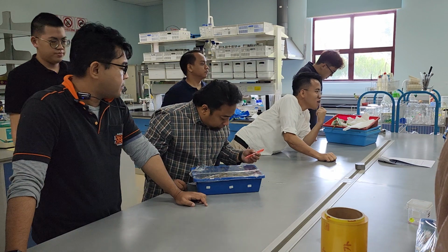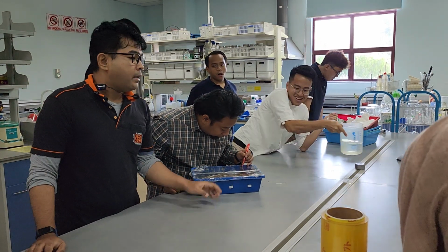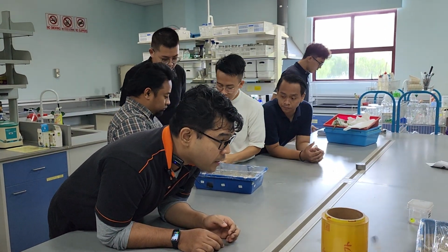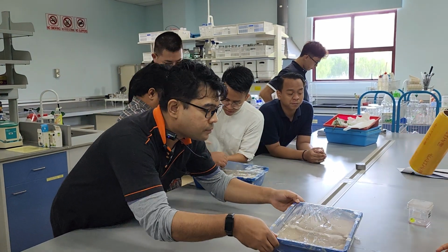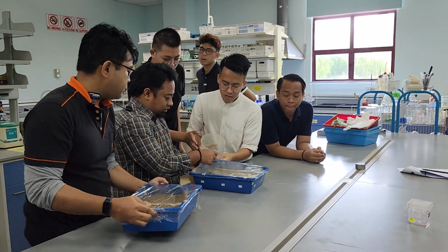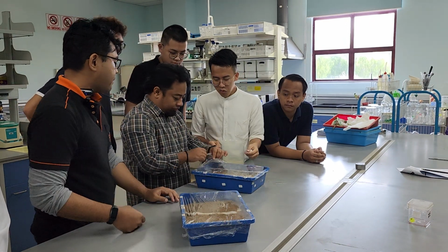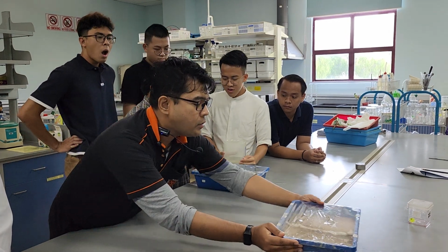Okay, dah. Sebelah apa sebelah? Okay. This group is done. You do that. How's your soil? Does it look okay? So this is one side. Lepas tu buka this side. Okay. That looks good. Sekejap ya.